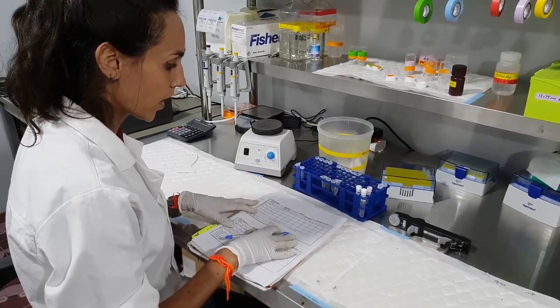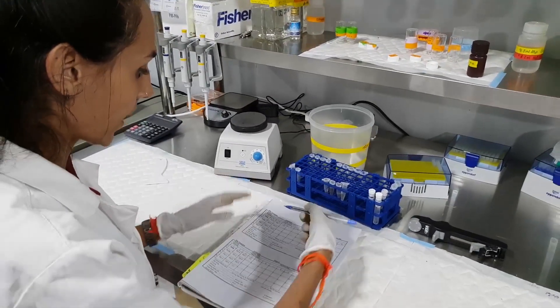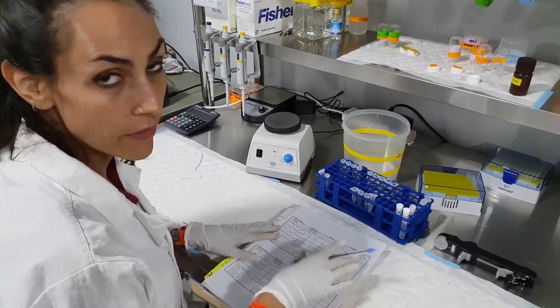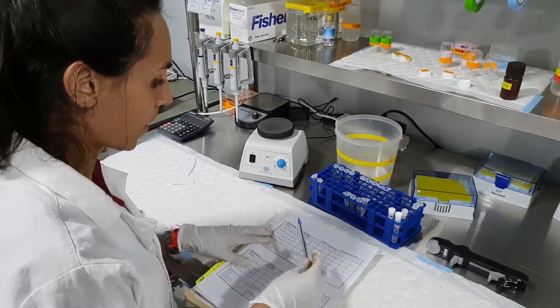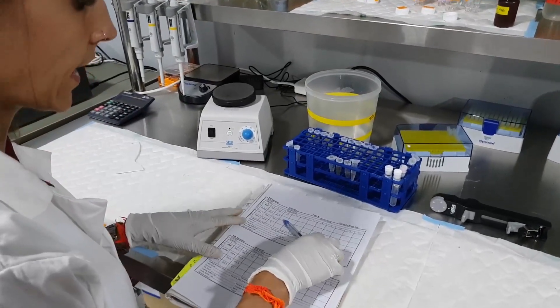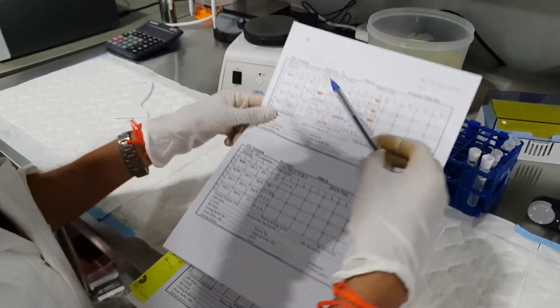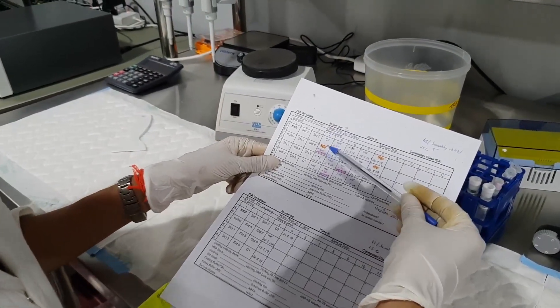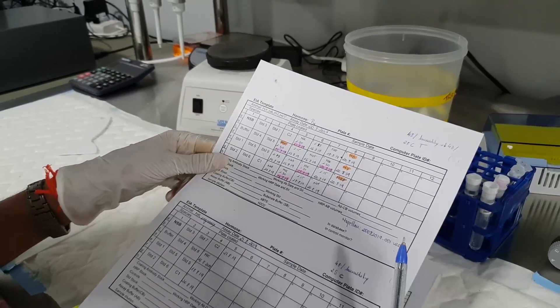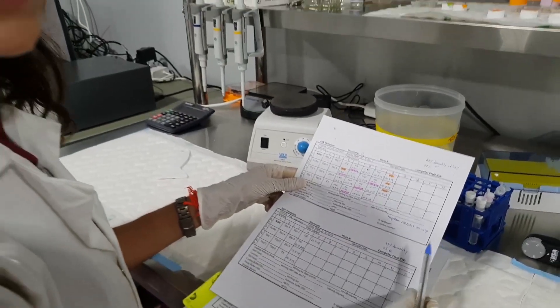So what I'm going to do now is make a plate map. I'm going to write in the order that I analyze the samples. So then in the future if I want to know what samples I analyzed and go back to our data, I can have here an old copy, so we can see if there were any dilution, the date, what elephant it was. So when I go back to the computer, I can review the results in case I need it.